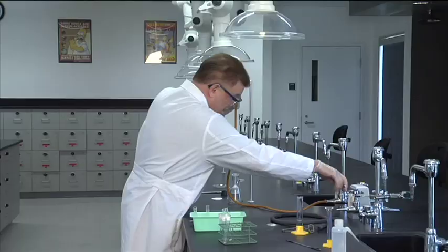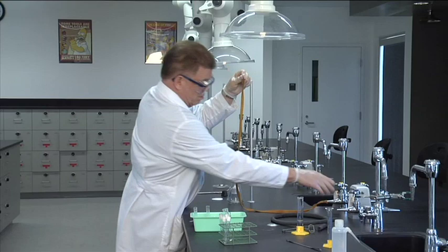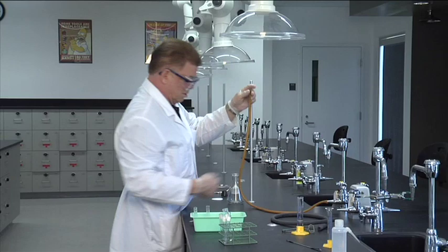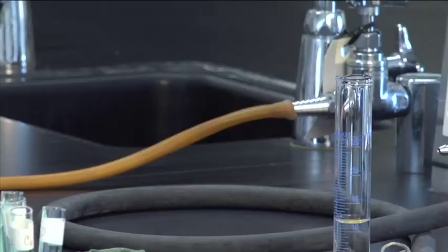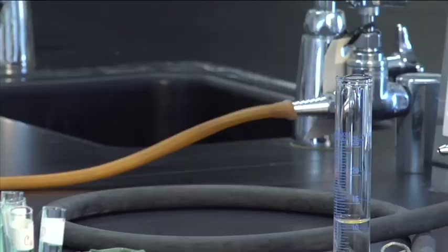Let's see what happens. Did you see that? Here we go. Hose pinch. Can you see it collapse? You got no vacuum through there. See that? See how it collapses?